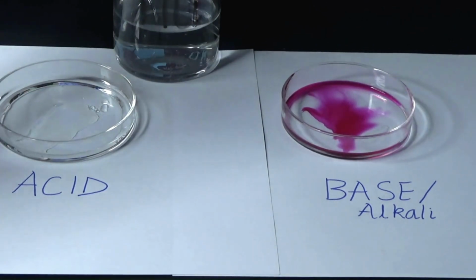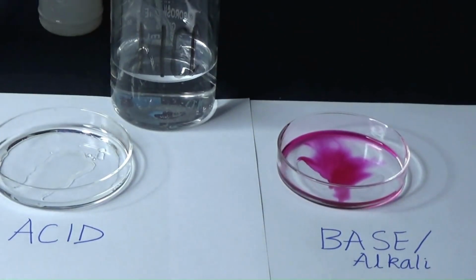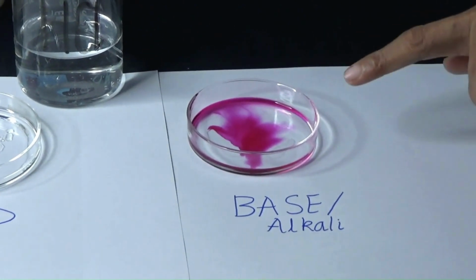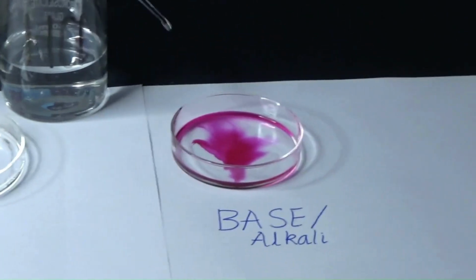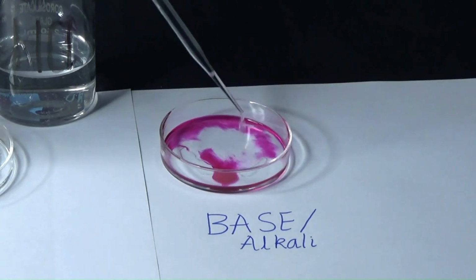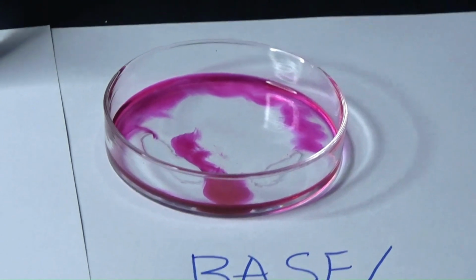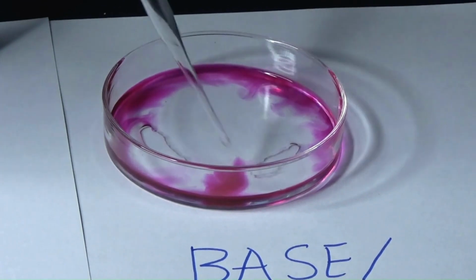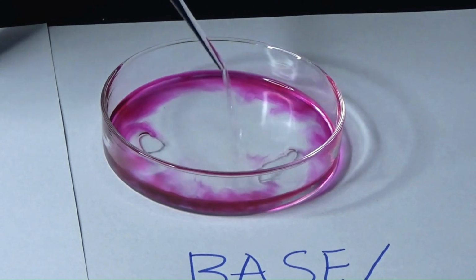Now here's something very interesting. Acid and base are actually reverse of each other. They can actually neutralize each other to create salt and water. So acid and base actually negate each other. So here we had base with phenolphthalein. Let's try putting some acid. As the acid neutralizes the base, the color starts fading away, because phenolphthalein will not give color with plain water. Since plain water and salt is being generated, the color is vanishing.